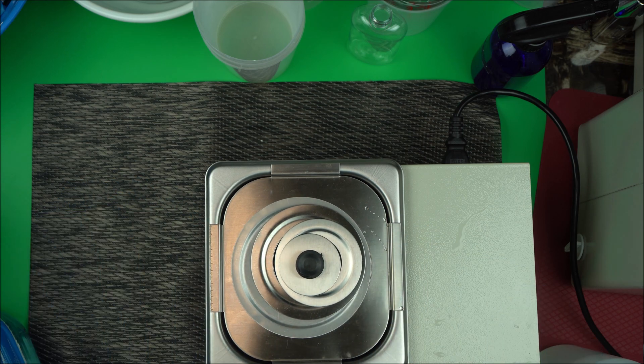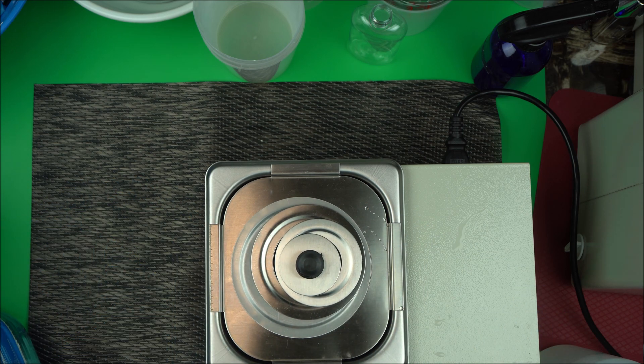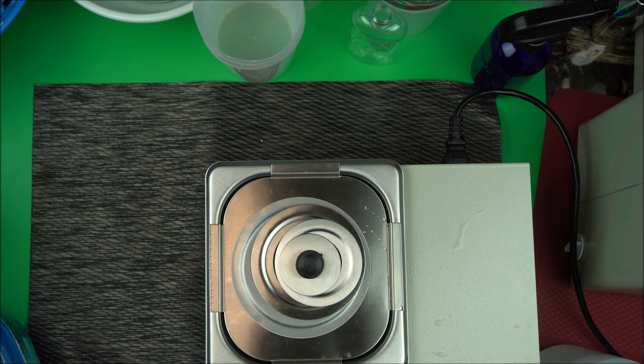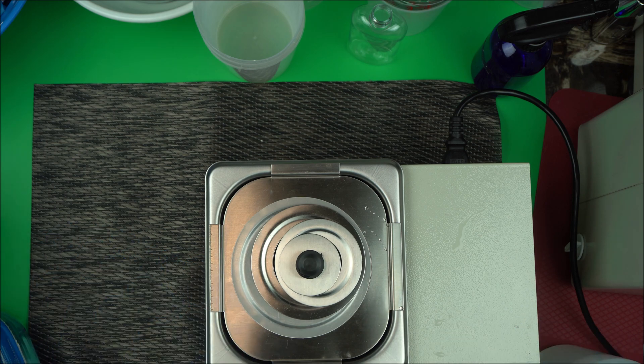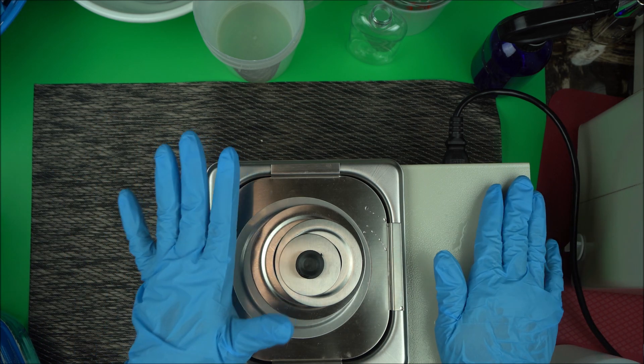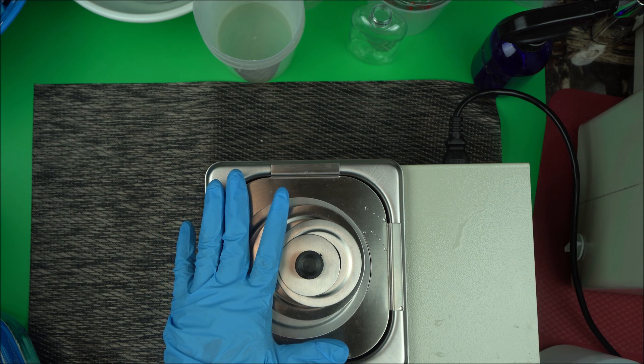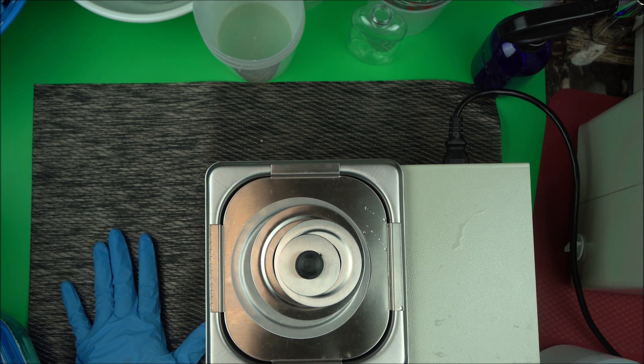You can use this water bath to melt anything you want, to increase the temperature of water, warm your water, melt your oils, melt glycerin when you're making infusions and so on. A very dandy tool that you need when making lotion.